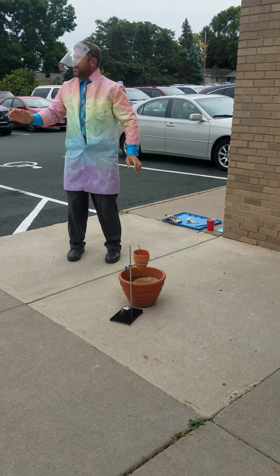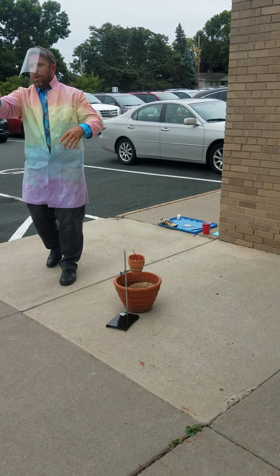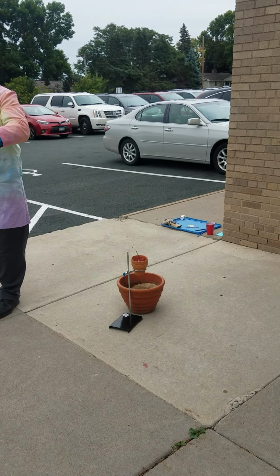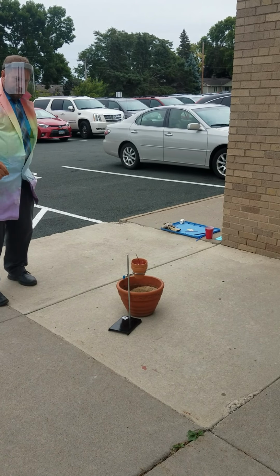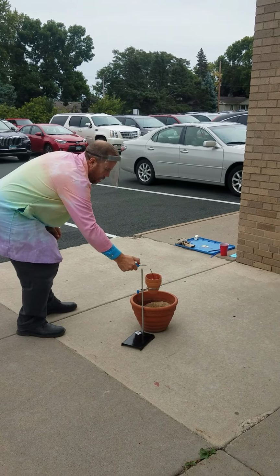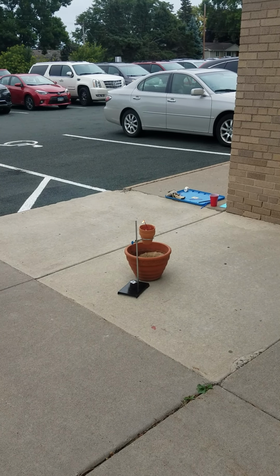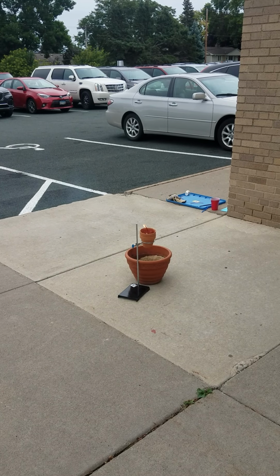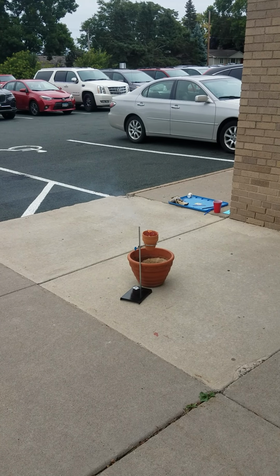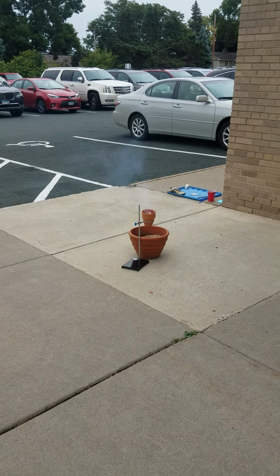All right, let's see. Wind's going this way, okay? I'm going to have you guys, except for the camera guys, step back a little bit more. Step back a little bit, gentlemen.